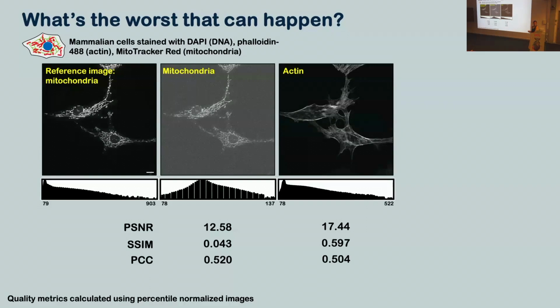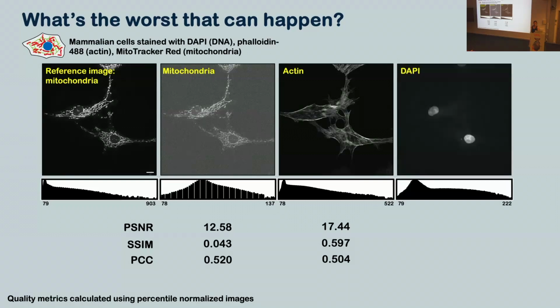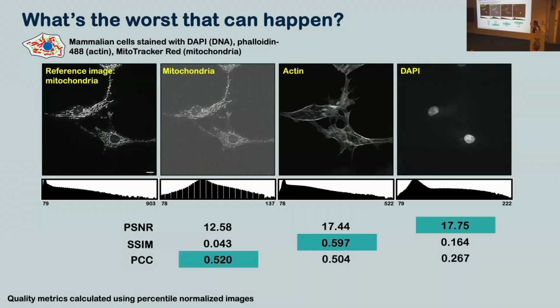And you might think, oh, well, you know, I'm being a bit facetious here. They're kind of the same shape. They're kind of the same intensity distribution. It's okay for metrics to get it wrong every so often. All right, let's look at the third channel, which is the nuclei. Again, we've got quite a different intensity range to our reference image, and we've got almost the opposite in terms of structure. How do the quality metrics rank our nuclei image against our reference mitochondria? Again, we've actually got better PSNR and SSIM values than for the real structure. And so our three different metrics tell us that the three different images are the best match to our reference image. And this is not useful for biology.